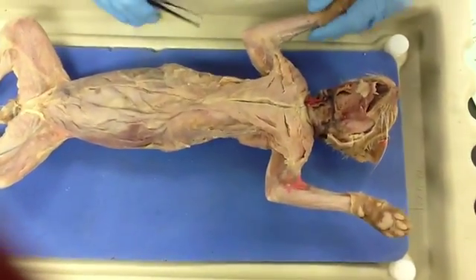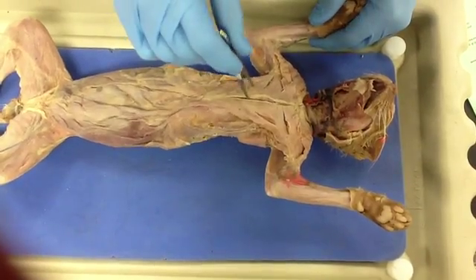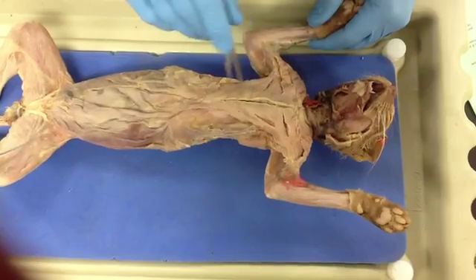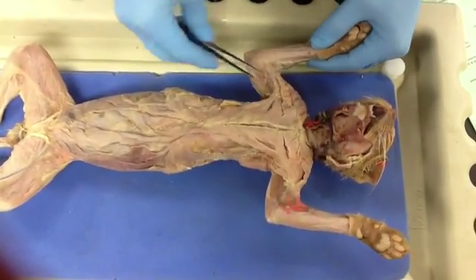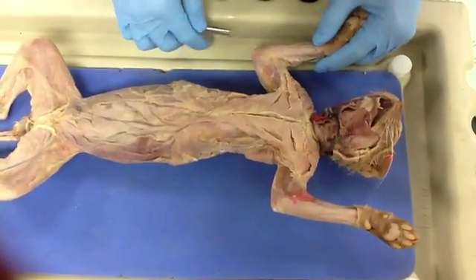And then the pectoralis minor, its origin is in the midpoint of the sternum, right here, extending downish to here. And then the insertion again is in the humerus, and it's the same as the pectoralis major, moving it caudally, keeping it in, and helping it run.